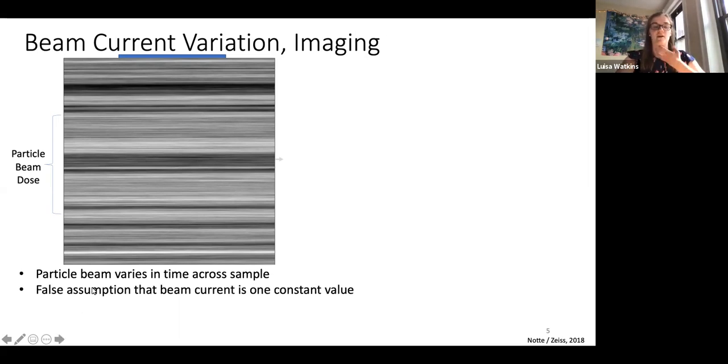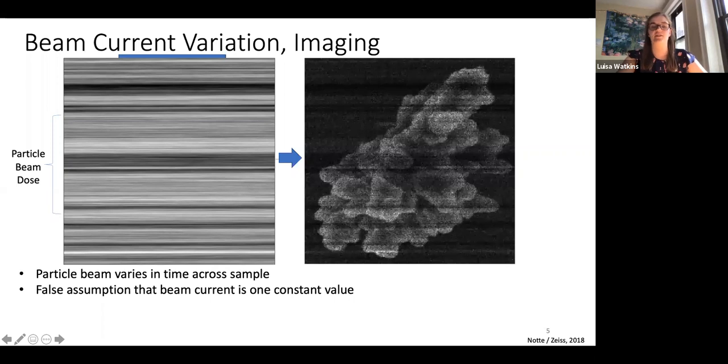Very often there's a false assumption that this beam current is one constant value. It's assumed to be one value, but it actually has this effect when it's different, changing as we go across the sample. So if this is our reconstructed image, you can see how these stripes affect it, because the darker stripes in the dose go along with darker stripes in the reconstructed image.